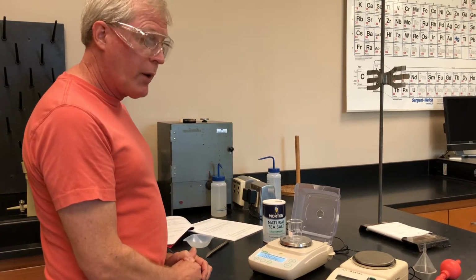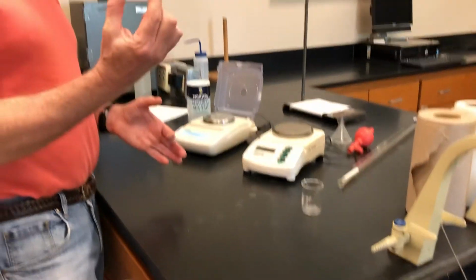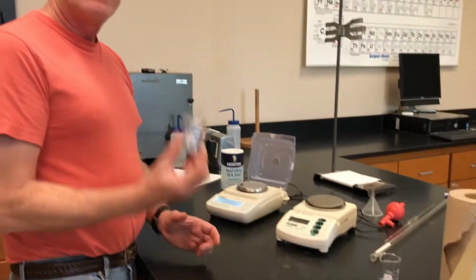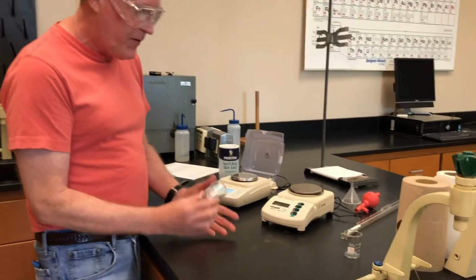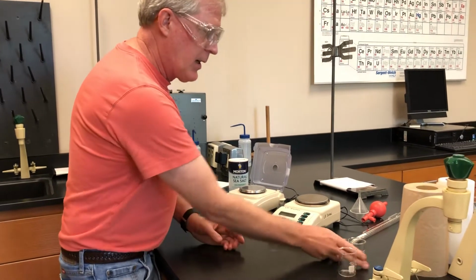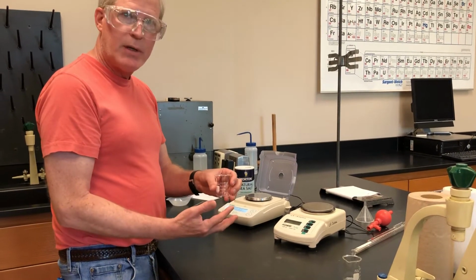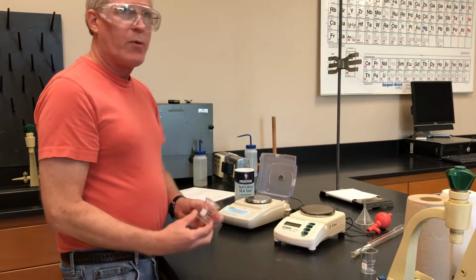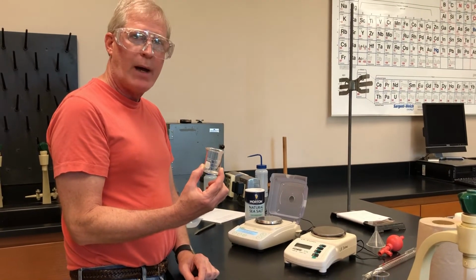And it looks like the task that I need to do here is record the mass of another 50 milliliter beaker. So I used this one right here, but now I'm going to swap to a different 50 milliliter beaker. And you're thinking, well, maybe they're all 50 milliliter beakers. Shouldn't they weigh all the same? If I accidentally borrow somebody else's beaker and I'm relying on the mass of it, that's not going to be very accurate. So one of the things that you have to remember is that each item that you have probably has a very unique value of mass on it.